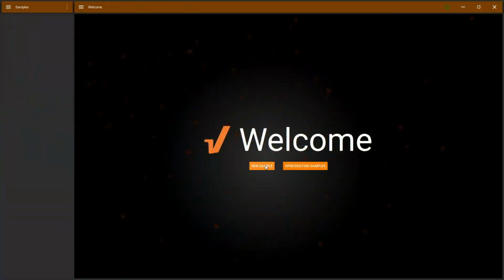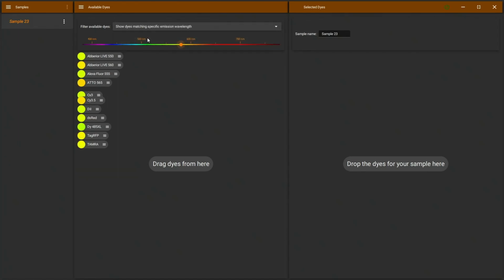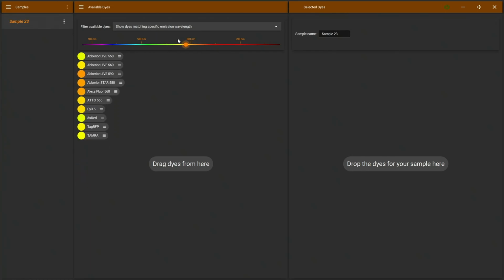I've infiltrated the leaves with water before putting them on the microscope. And now I'm going to use the autofocus to find our focal plane or the cover slip. Okay, and now I'm switching to the software. Here we have a choice of dyes. I can also select my dyes according to the wavelengths where they emit, so that's very handy. Or just go to the recent dyes.